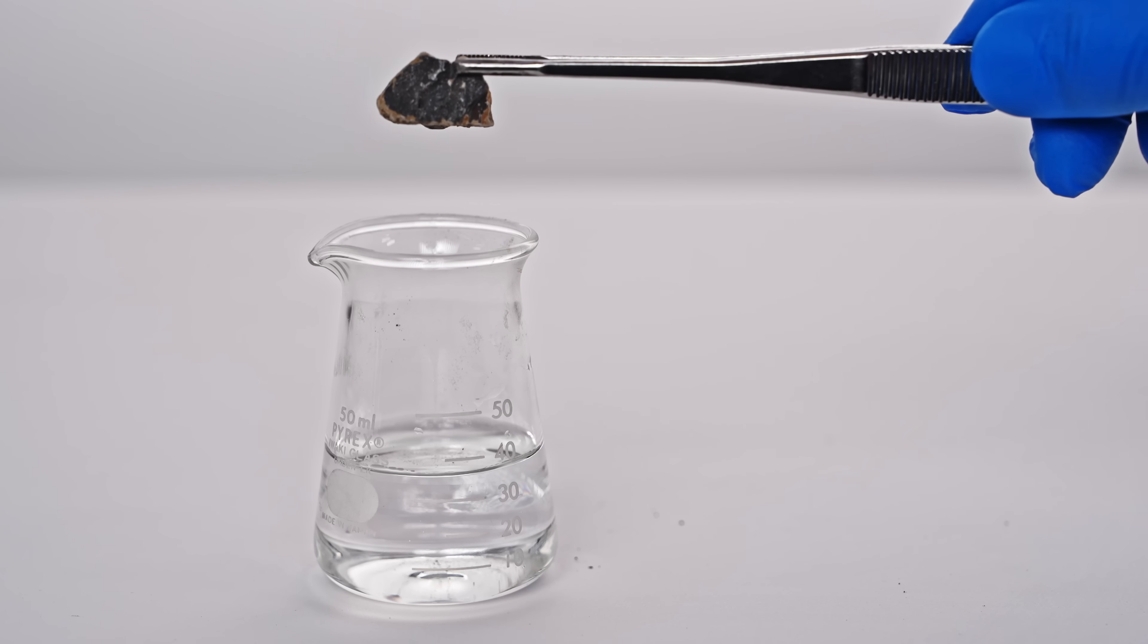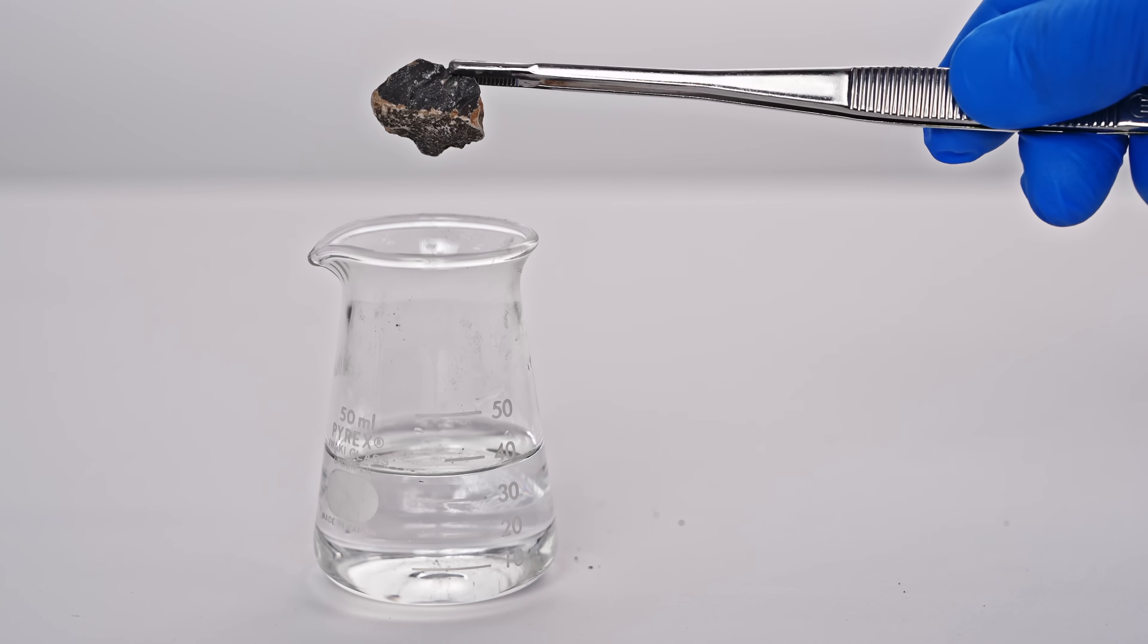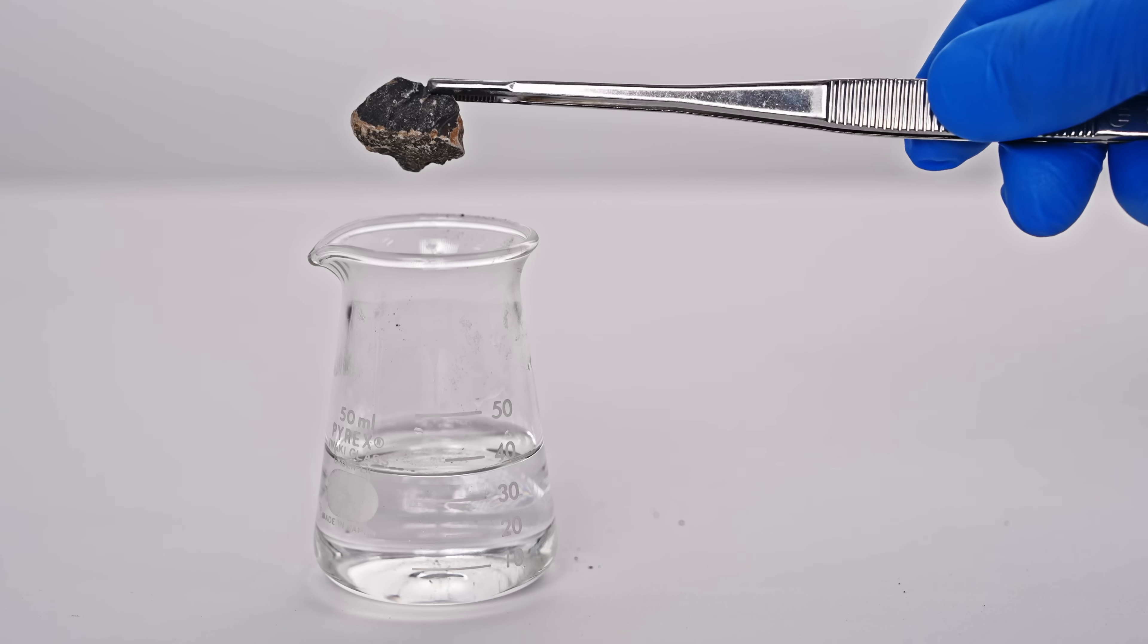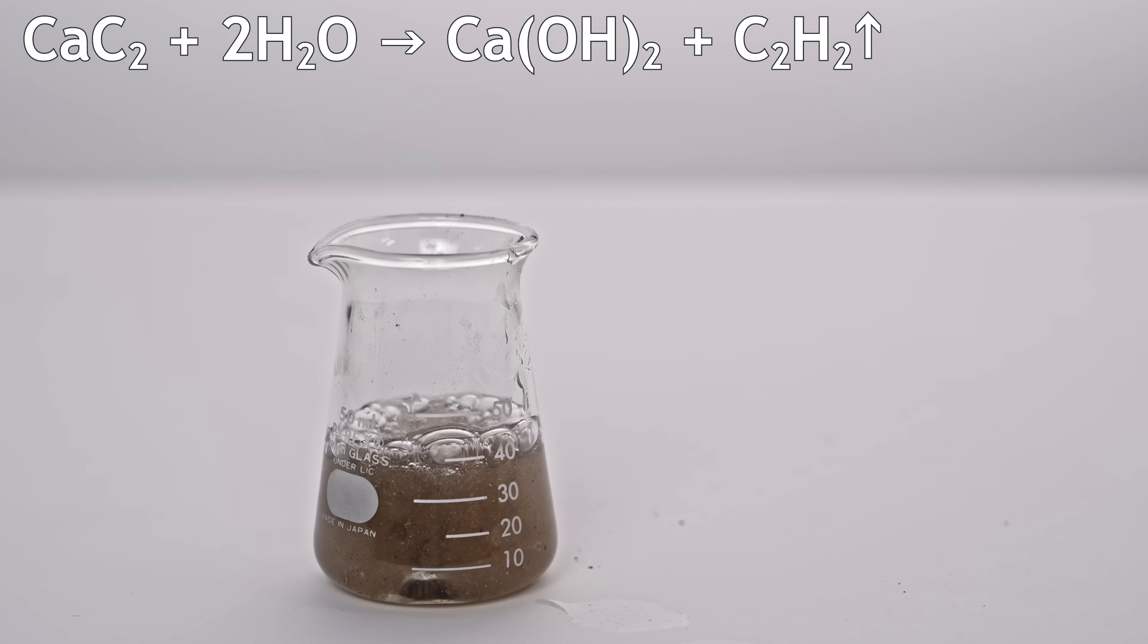This little rock here is just regular calcium carbide. When it reacts with water, it releases a flammable gas – acetylene.